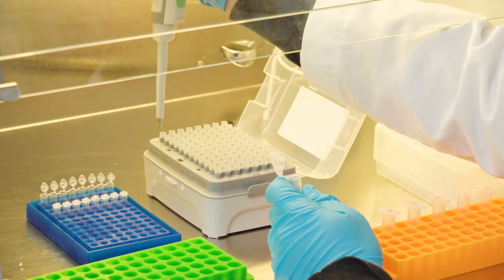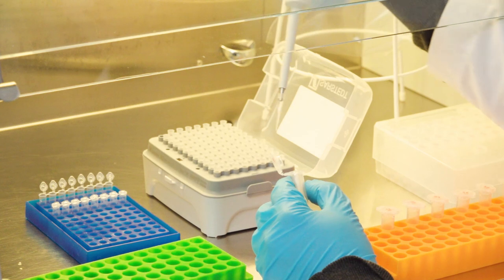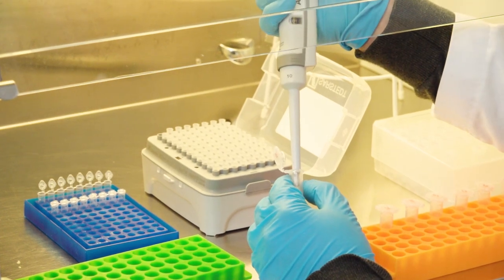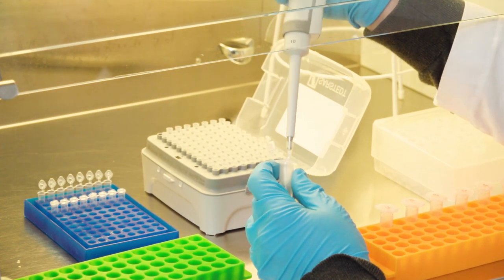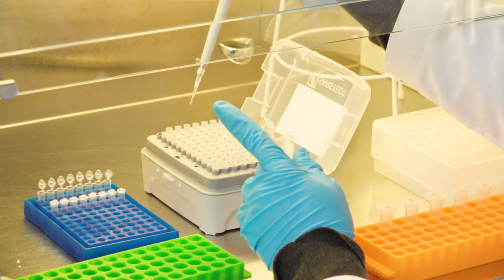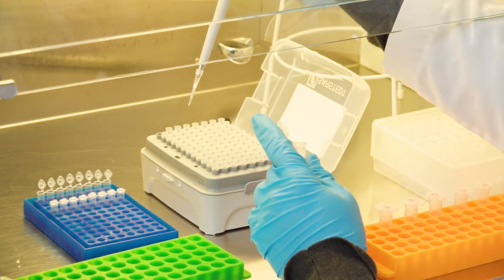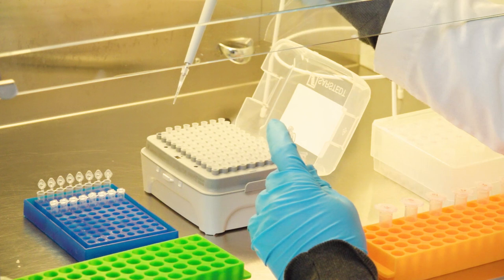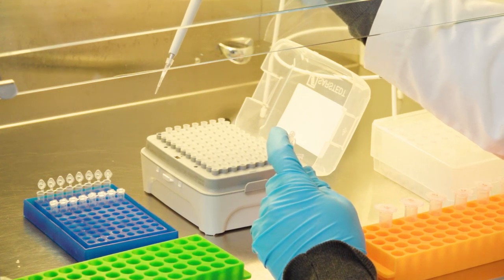Open the tube with samples, and suck up the samples. And here especially when you're working with small volumes, it's very important to look at the pipet tip to see if you actually have gotten some of the samples.